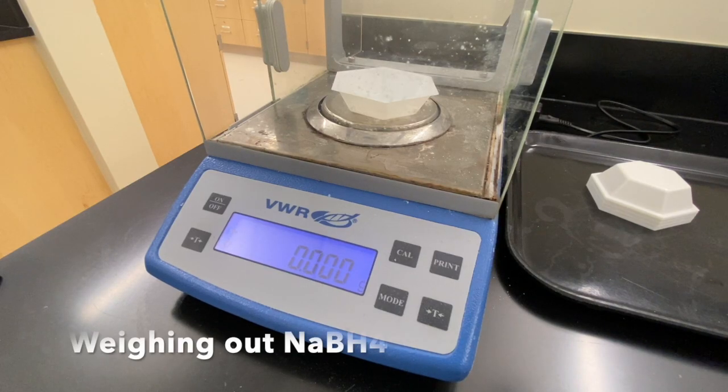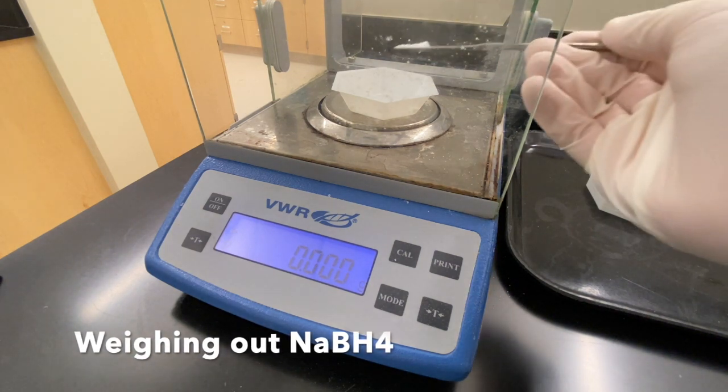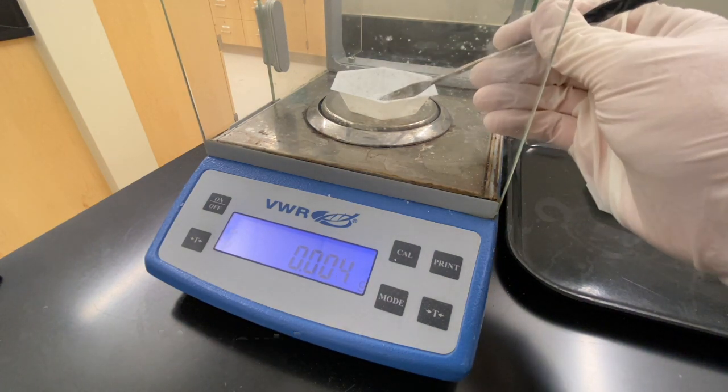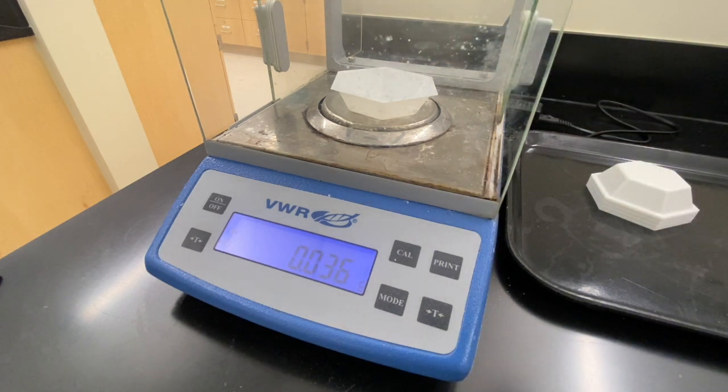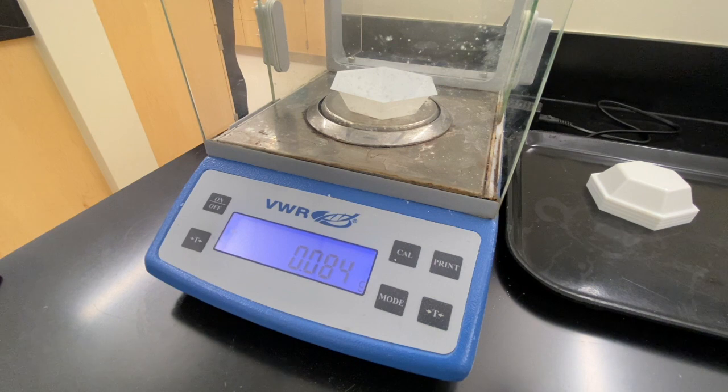Alright, so you're going to weigh out the sodium borohydride. We need 80 milligrams, 0.08. 0.084 is, as they say, good enough for government work.